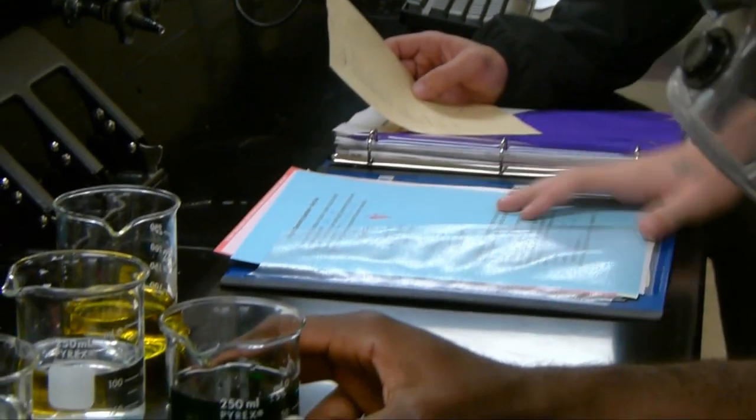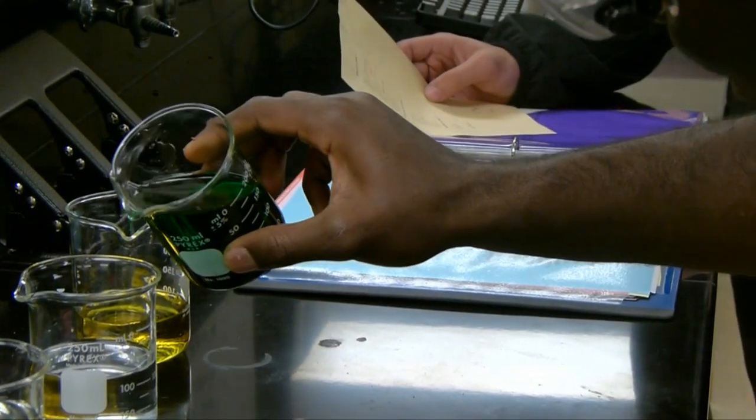Keep it out 100 milliliters. Alright, no. Let's make this like 100. Yo, Humphrey, no, stop, stop. You won't drink this.